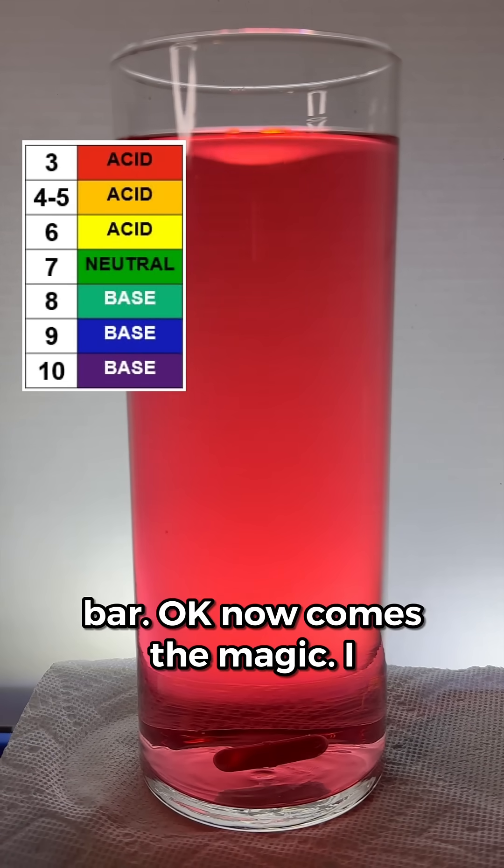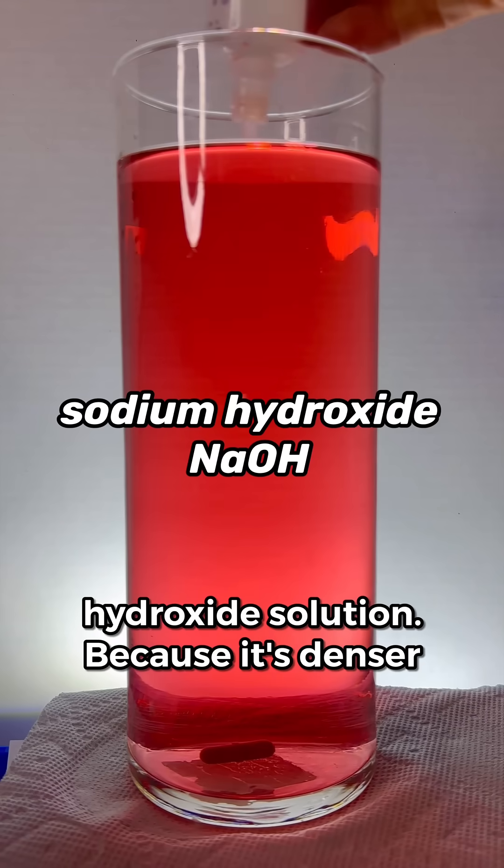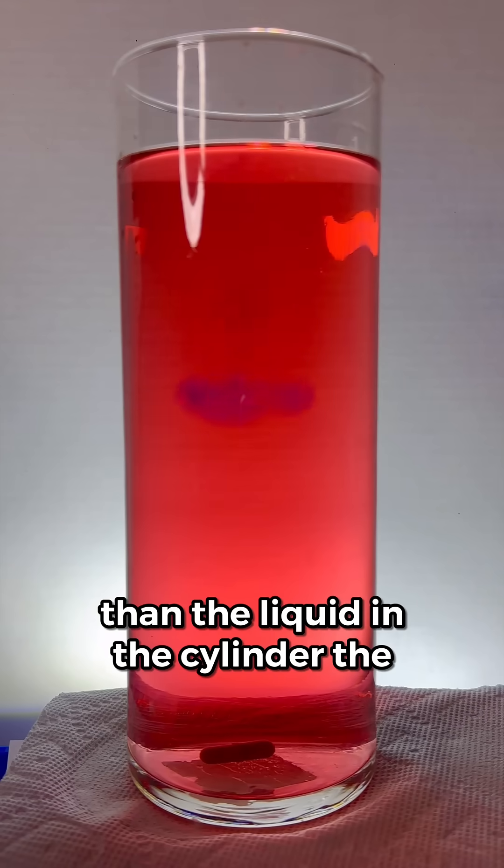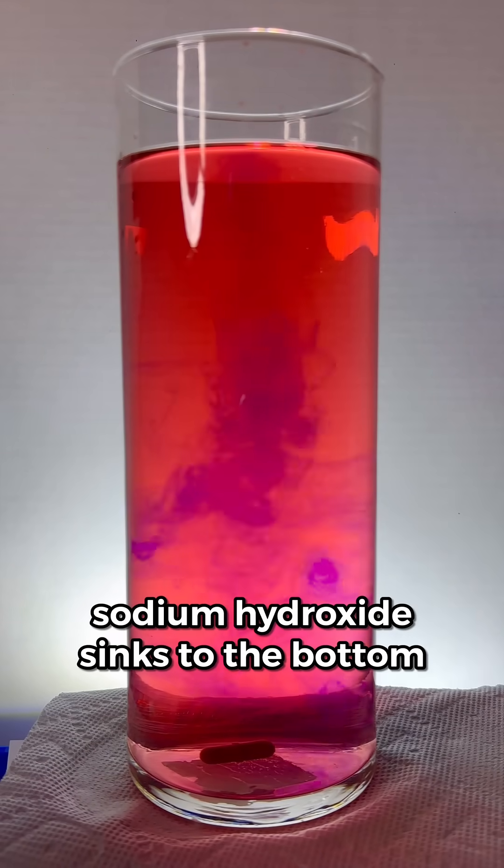Okay, now comes the magic. I carefully add a few drops of sodium hydroxide solution. Because it's denser than the liquid already in the cylinder, the sodium hydroxide sinks to the bottom.